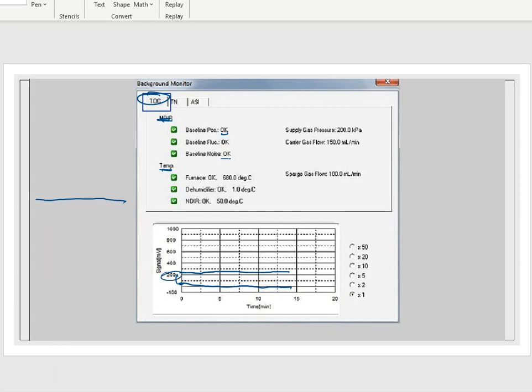So the signal here is a 200 for our Shimadzu. If it's lower than 200 in signal, which is millivolt, then that machine will be okay. It will not like the elevated baseline, but it's okay with it. And it will let you run samples, and you can still get data, and you can still record. However, over time, the NDIR could start to decompose if you're not keeping a routine maintenance schedule on it, if you're letting your halogen scrubber or your filter go bad, if something is causing a problem and it's starting to corrode the NDIR, then you're going to see a higher than normal millivolt signal. And when this goes over 200, it could be a very bad sign.